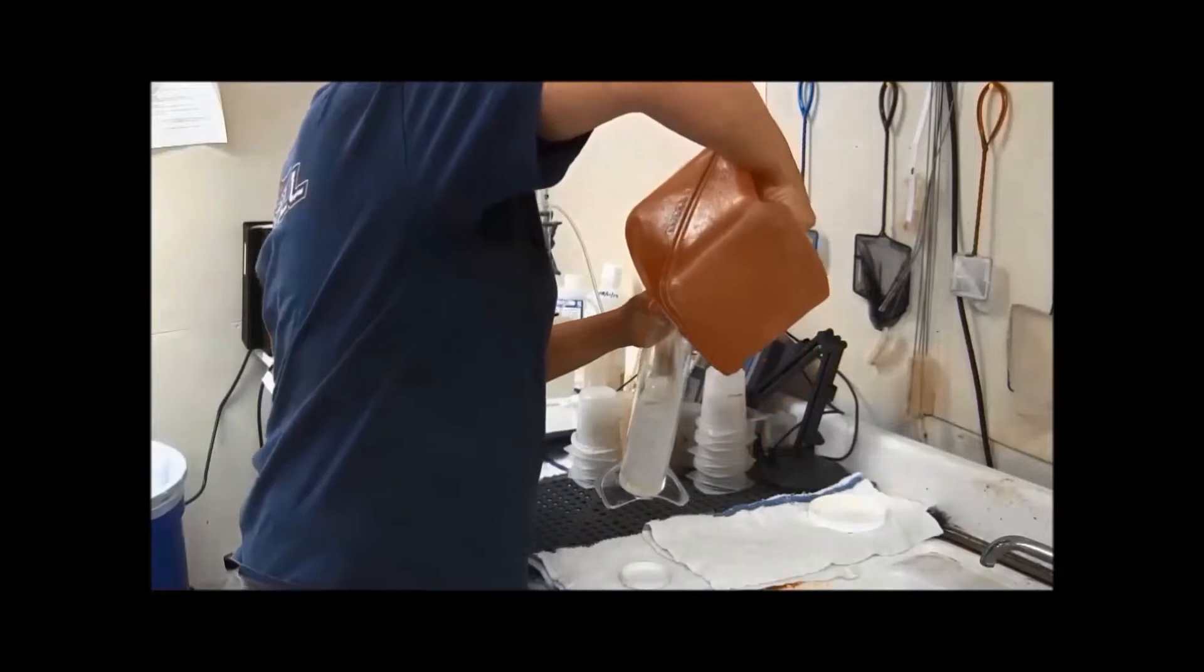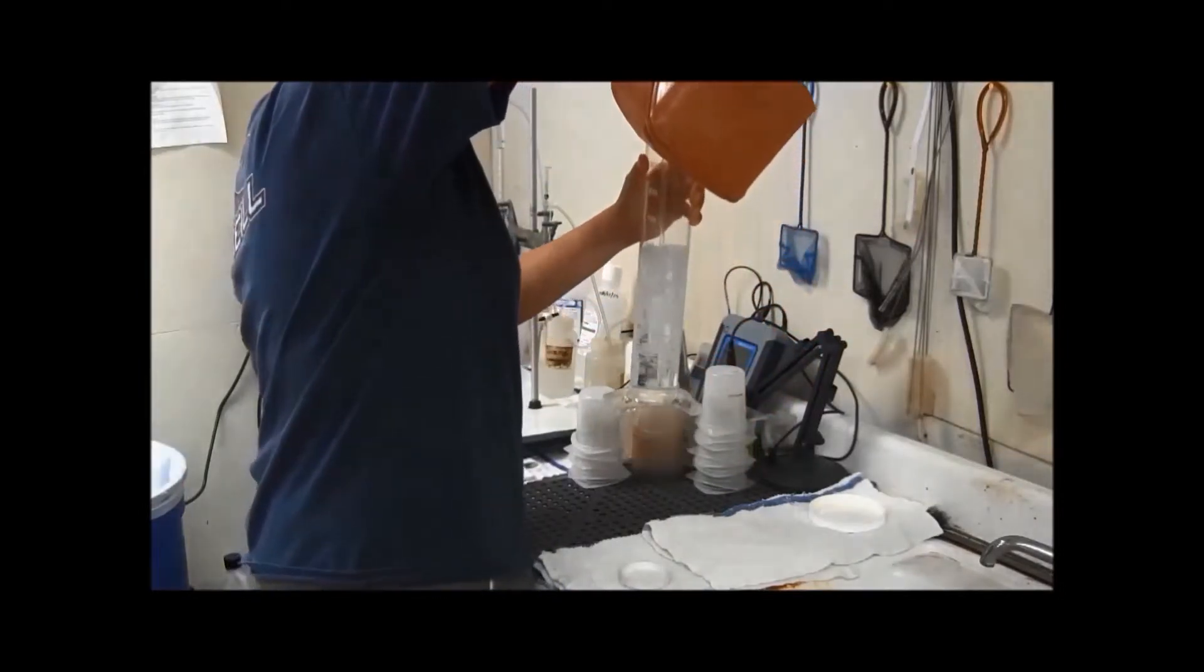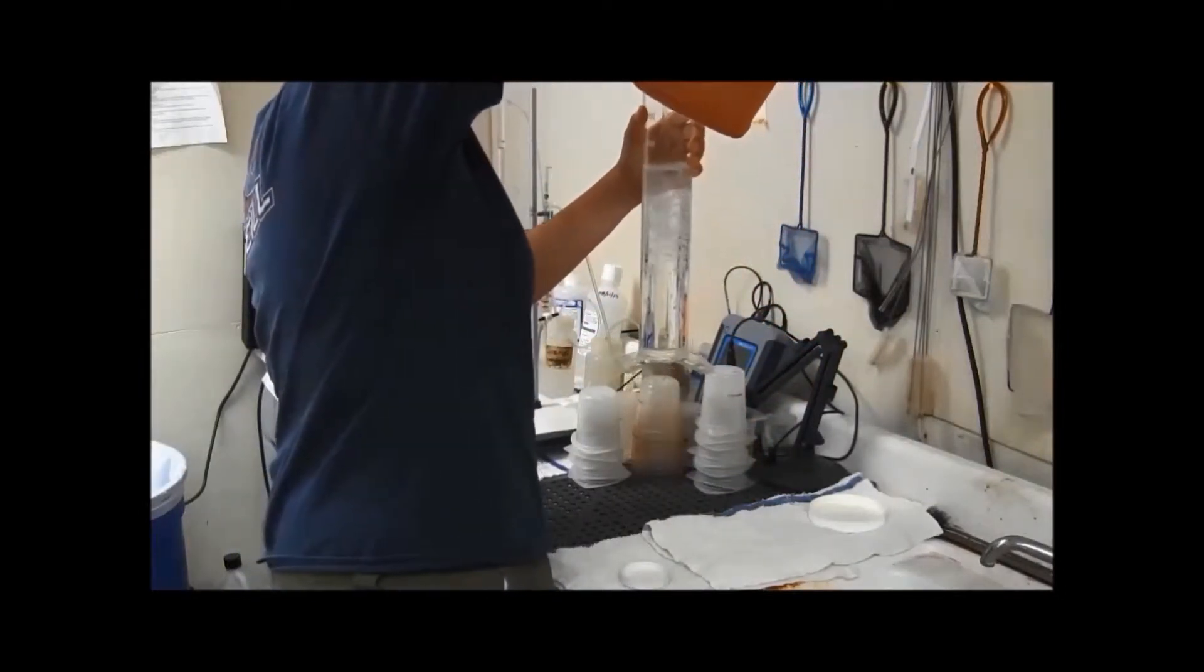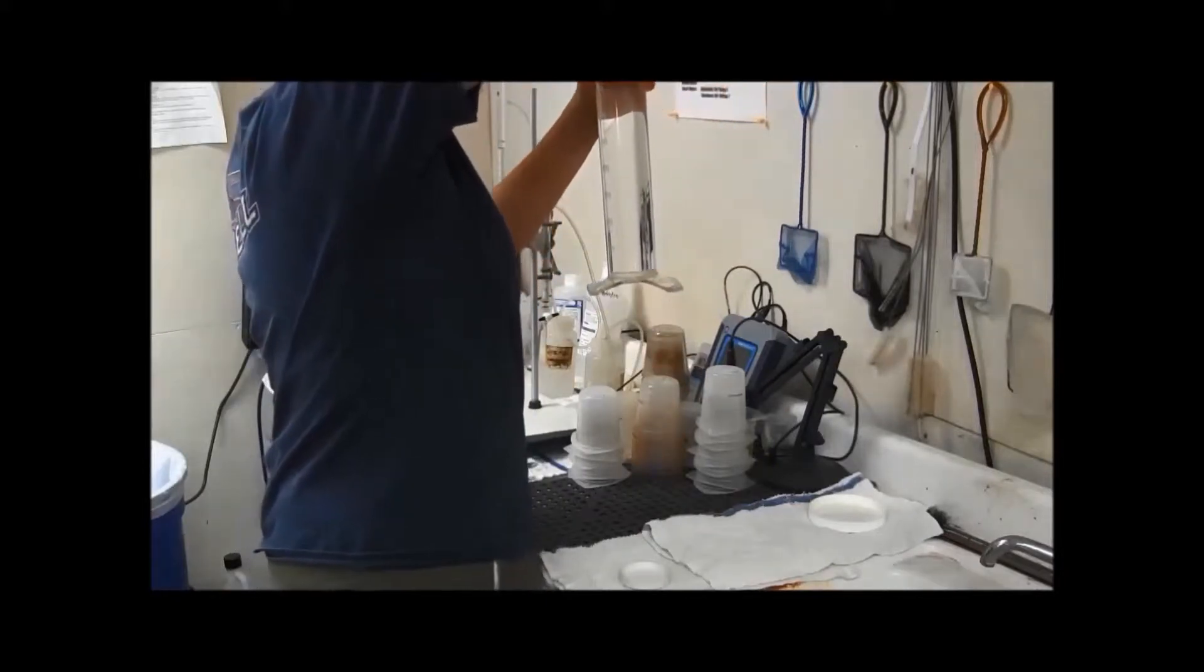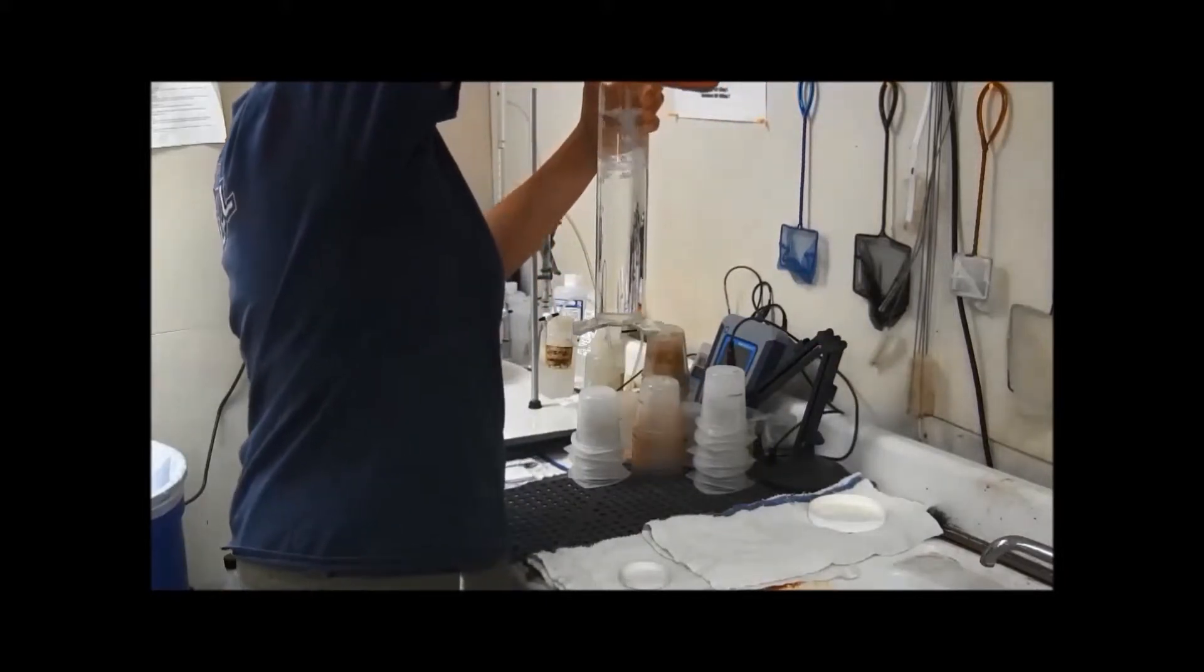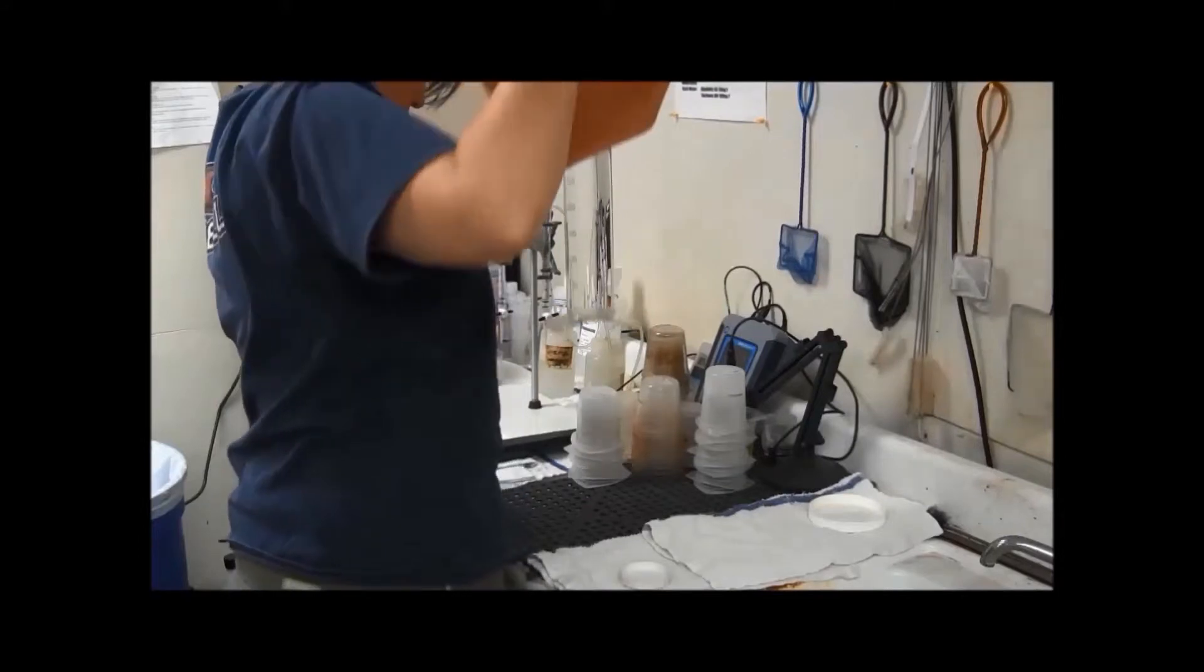I'm going to pour this to where it's 750 milliliters, and we're going to double check this too a little bit later.